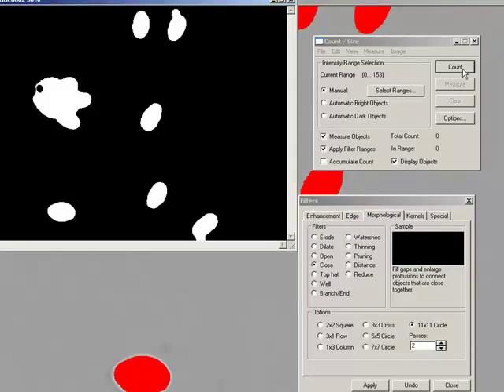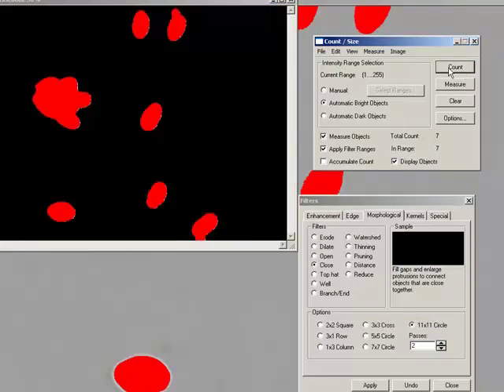So if I just press count now, actually, count bright objects now. There we are. I can now see I've counted every object there. So how do I handle this? Because this clearly is one, there's one, there's one, there's one. Well, the easiest way to handle this is by a cluster.